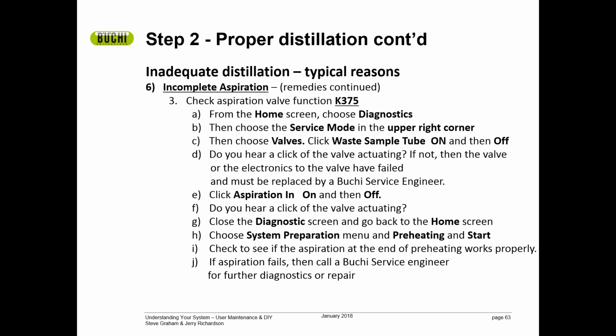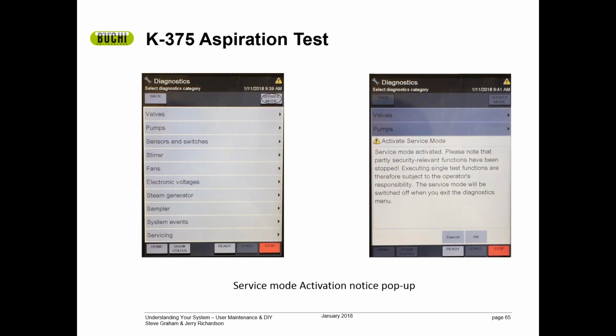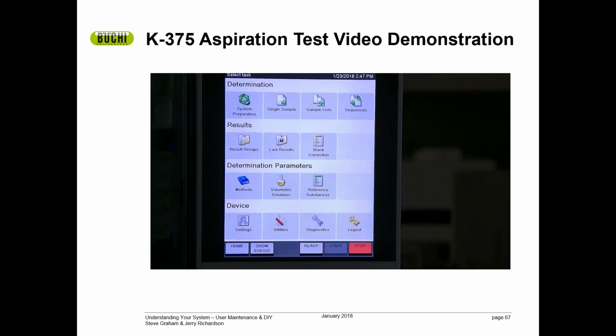Okay, so on the K375, we're just going to go through a little exercise real quick. If you're having problems with aspiration, this slide shows a depiction of how to go through and use the diagnostics on the software to diagnose problems with the aspiration. What we'd like to do is use a video to actually show you how that is accomplished. So on the system, here again, we go through the diagnostics mode, and we're going to turn on and off that aspiration valve.